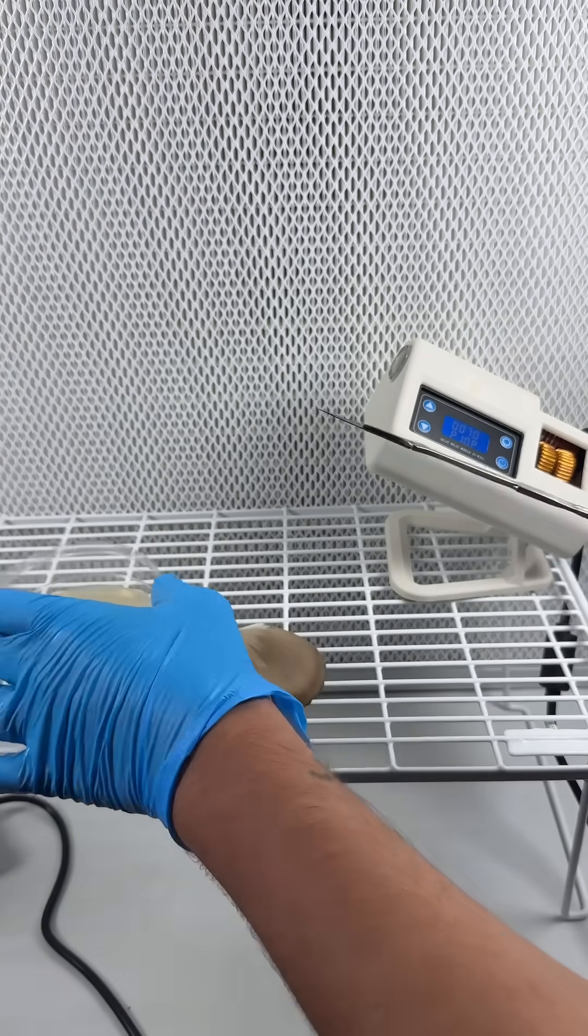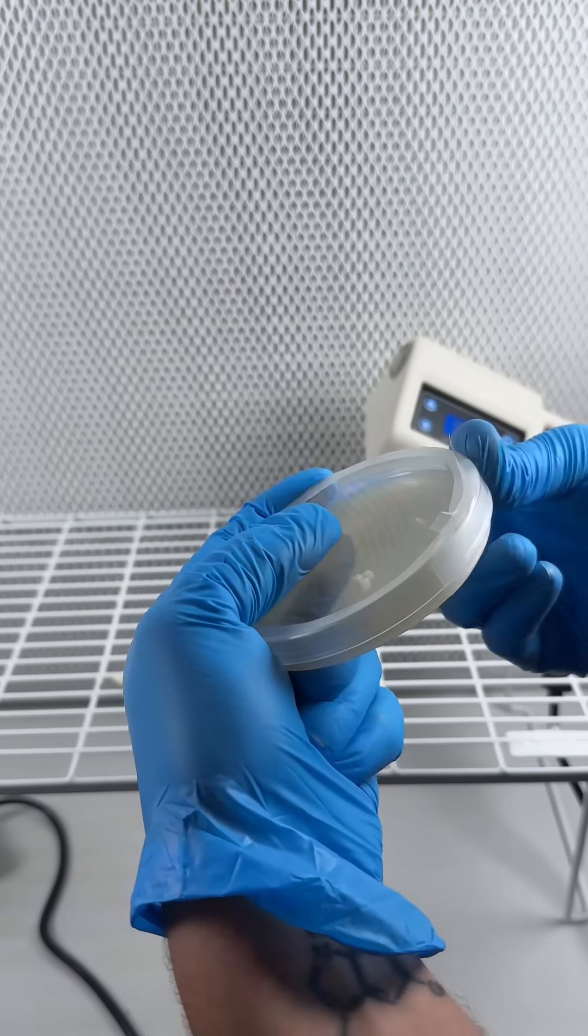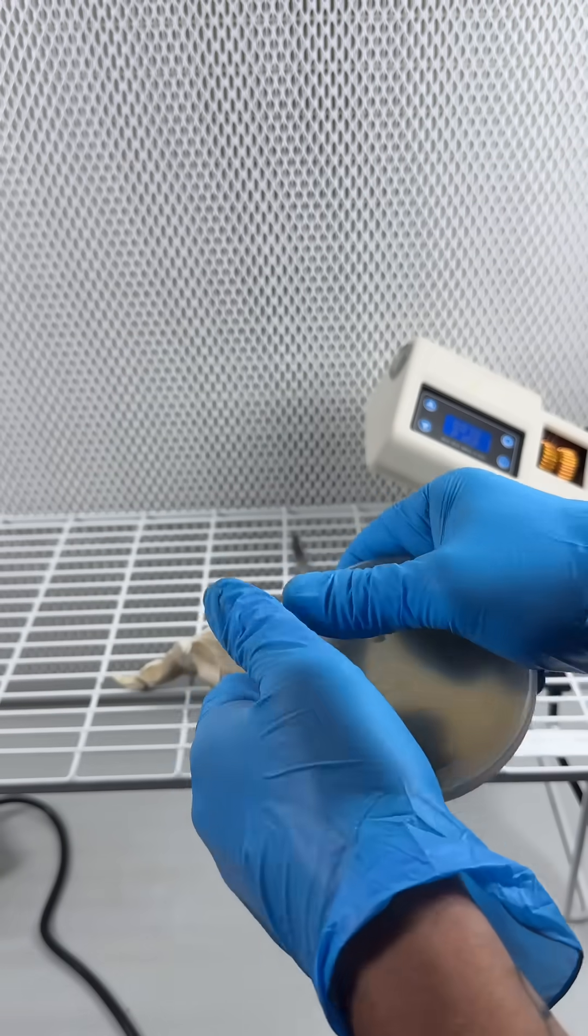You can see I'm wearing gloves but I'm also wearing a mask and I'm working in front of this vent which is a laminar flow hood that blows clean air over the work area and prevents contamination.